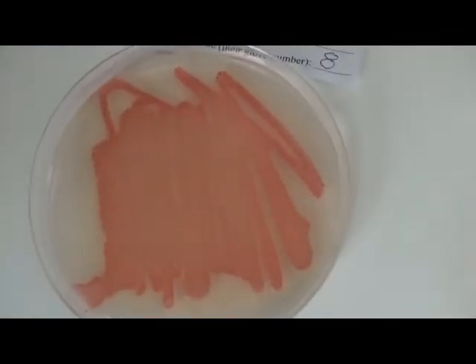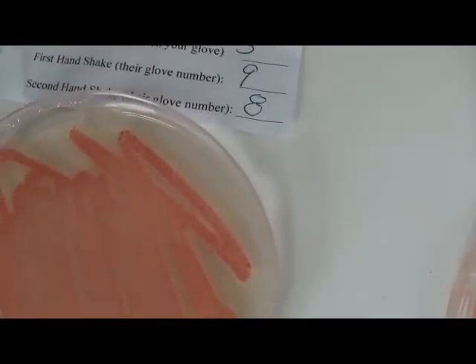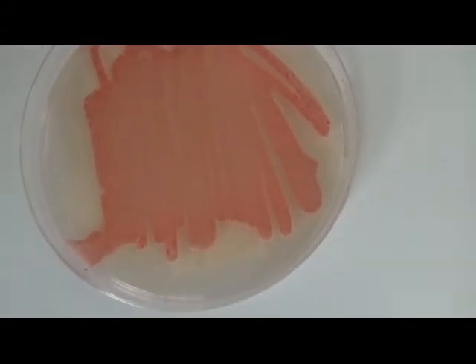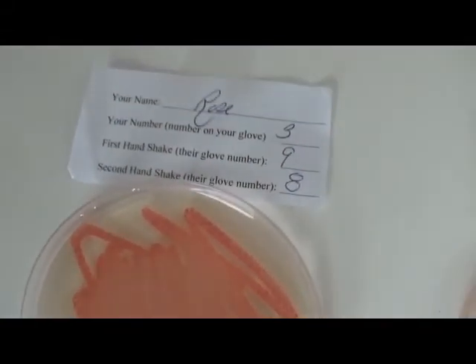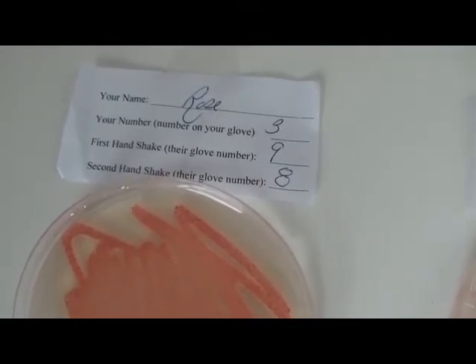So there are actually some plates you can see that have just a straight lawn. You can't even see a divide of many individual dots. There are some towards the edges where you can actually count dots. You would just call that a lawn, and you would say that's so much growth that it probably had to happen early on, because the person that we know is patient 0 had an incredible amount on their hand.